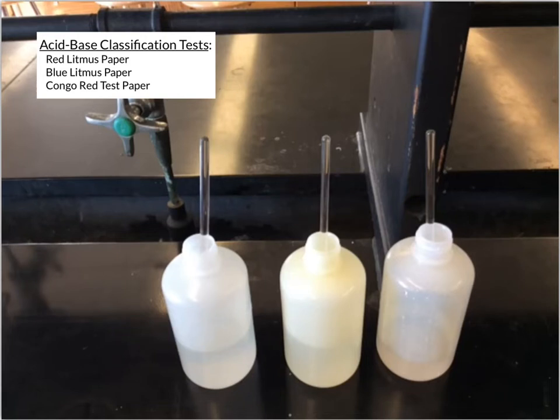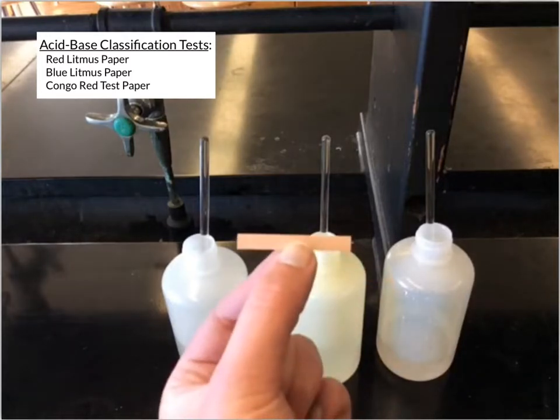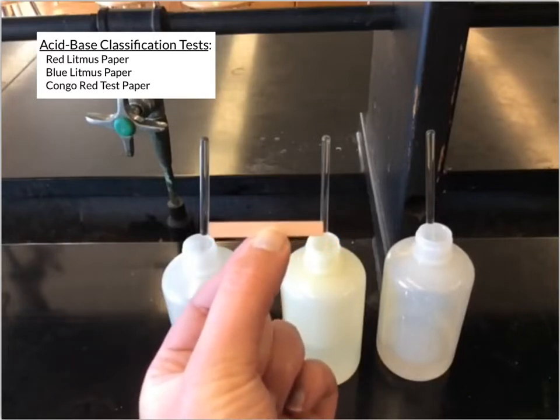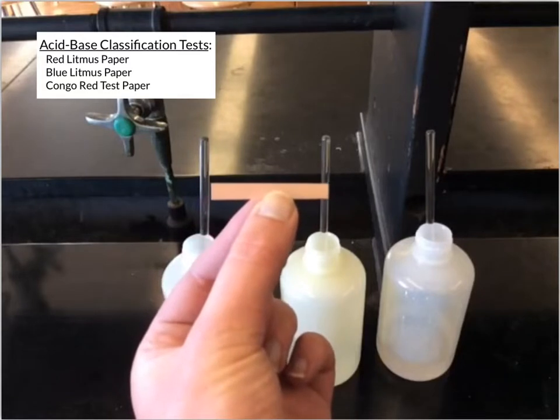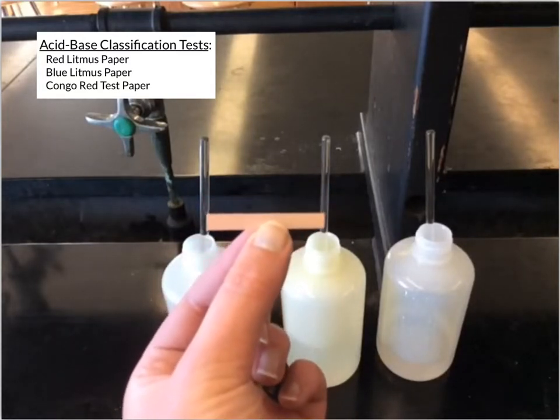We're going to look at the results that you would see if you were to test different substances with red litmus paper, blue litmus paper, and Congo red test paper. So I'm going to start with the red litmus paper. I have this little sheet of paper, and we can put a drop of a substance on there, and it may just leave the red litmus paper red, but it also could change that red litmus paper blue, depending on the properties of that particular substance.